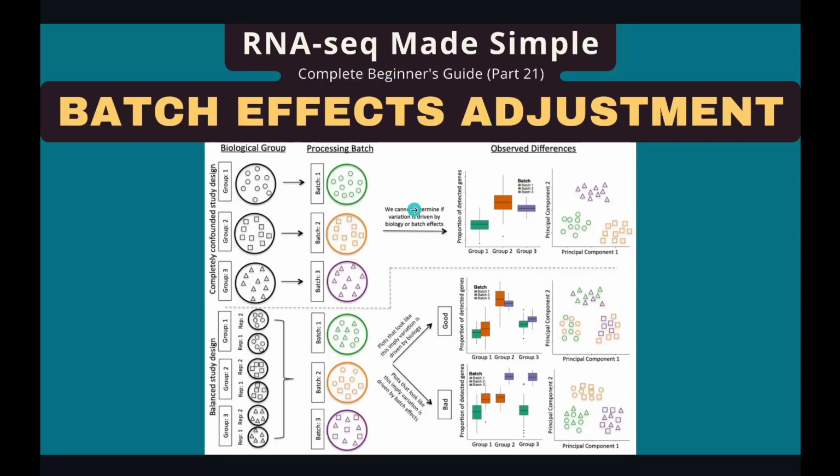For example, in this study, colors represent batches, shapes represent the groups. Samples in each group are sequenced independently, so we have 3 batches and 3 groups. In the PCA plot, the samples are clustered by groups as well as by batches. So it's impossible to tell if the differences between the groups are caused by biological conditions or just by batches. It's completely confounded. This is the worst study design.